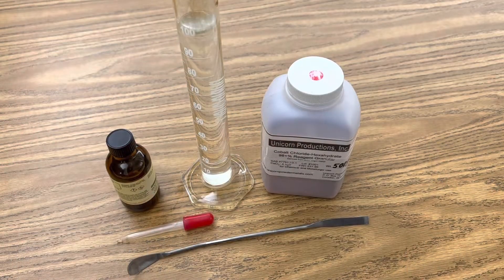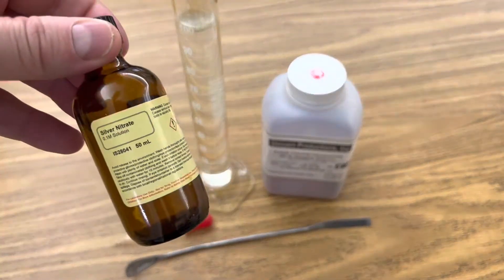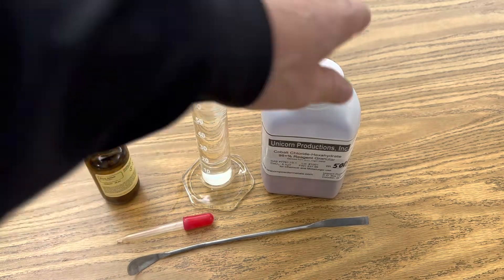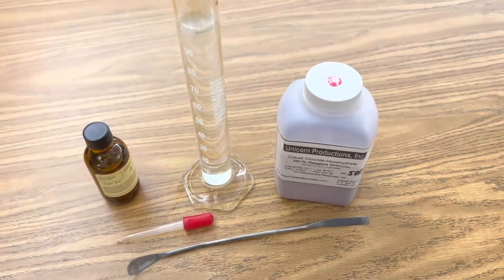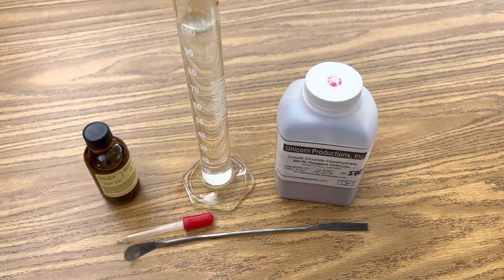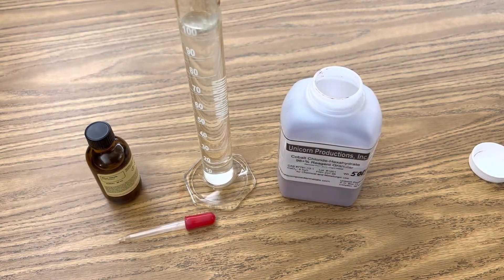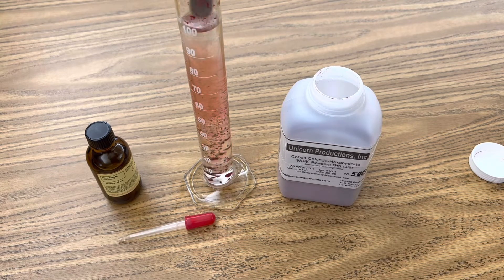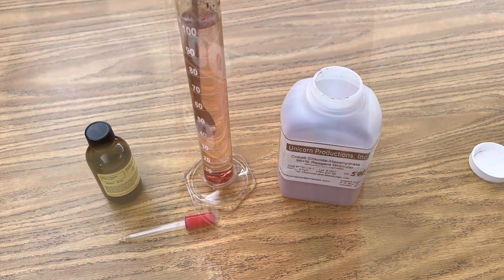In this double displacement reaction I'm using silver nitrate, already in an aqueous solution, cobalt chloride, about 100 milliliters of distilled water in a graduated cylinder, my dropper, and my spoon. The first step is to add about four grams of cobalt chloride to 100 milliliters of distilled water and stir your solution until it becomes aqueous.